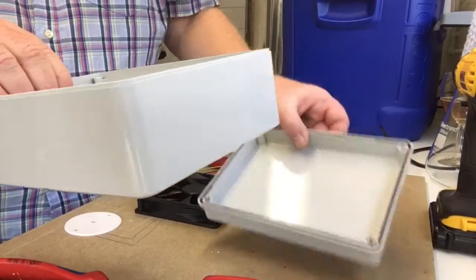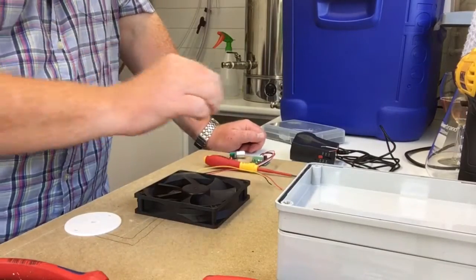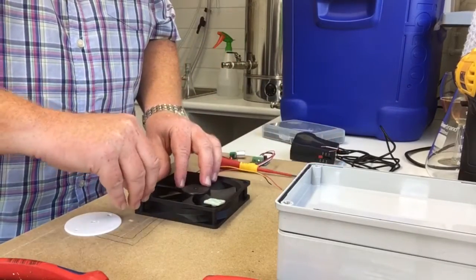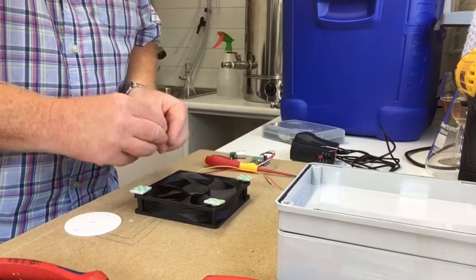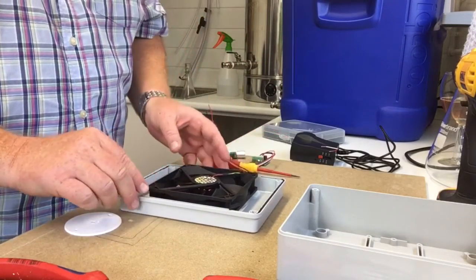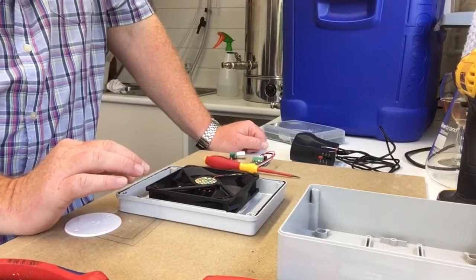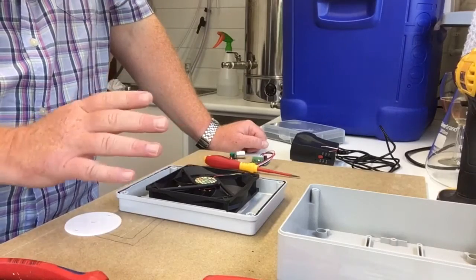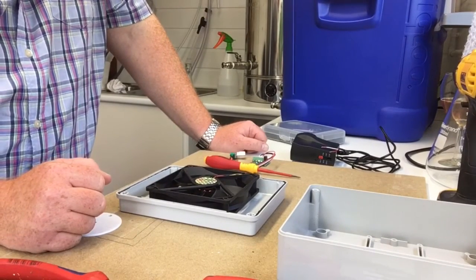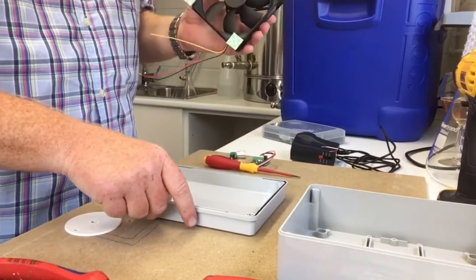I'm not going to be mounting it to the bottom of the box, I'm going to be mounting it to the top of the box. Plenty of clearance. So once I've got those mounted, I'll show you. Boom, boom, boom, boom. That fits there absolutely perfectly. Now, I will stick it down with the sticky pads to start with. And if all is working well and all is fine, I'll scrape the pads away very carefully with the scalpel, and I'll put some Grip Fill on. Or maybe I'm confident in what I'm doing and I'll just put the Grip Fill on straight away. But as you know, once that's on, it ain't coming back off.